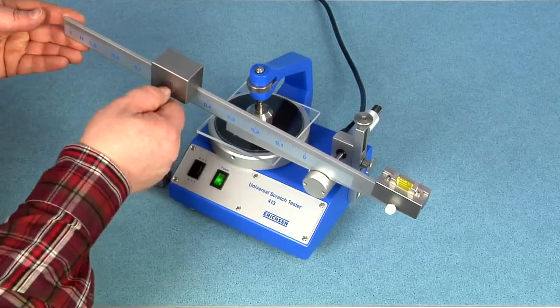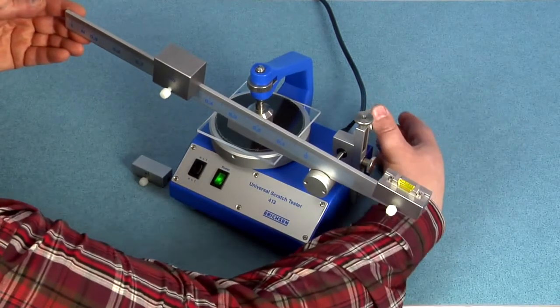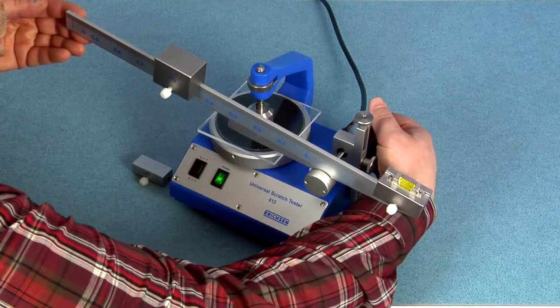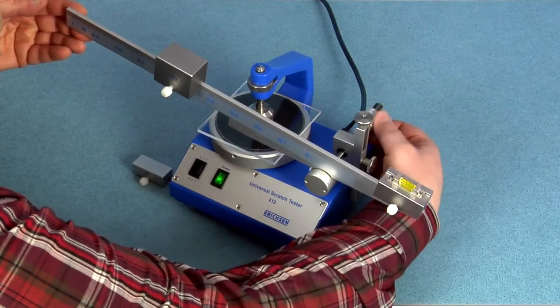Reducing the scratch force for the next trace. Reducing the radius for the next trace due to the circumstances, from minimum 0.5mm up to a few millimeters.